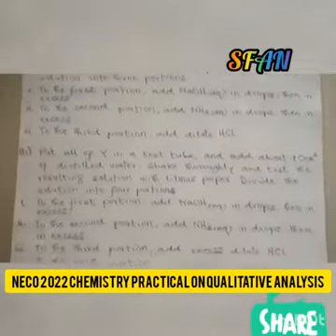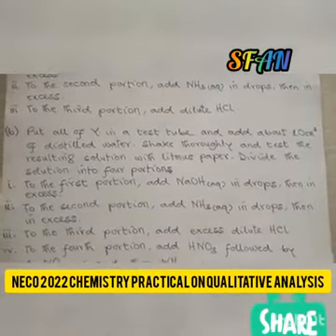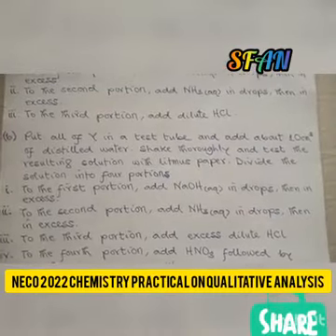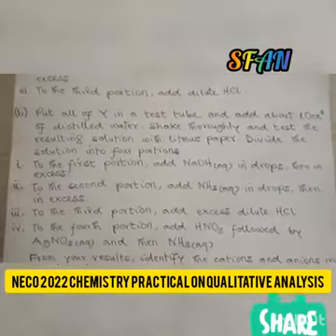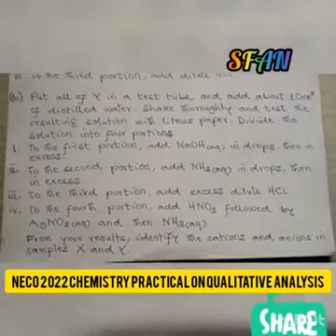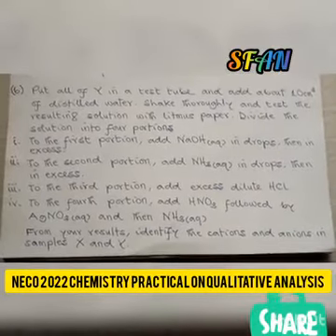B. Put all of Y in a test tube and add about 10 cm³ of distilled water. Shake thoroughly and test the resulting solution with litmus paper. Divide the solution into 4 portions. To the first portion, add aqueous sodium hydroxide in drops, then in excess. To the second portion, add aqueous ammonia in drops, then in excess.